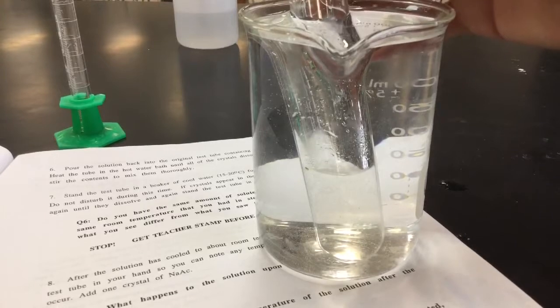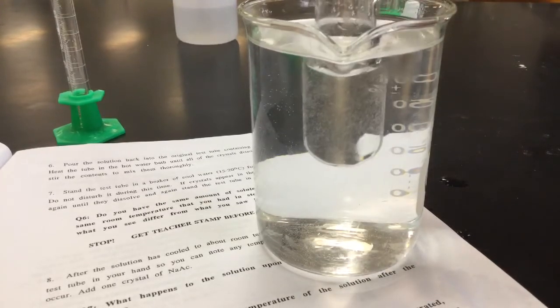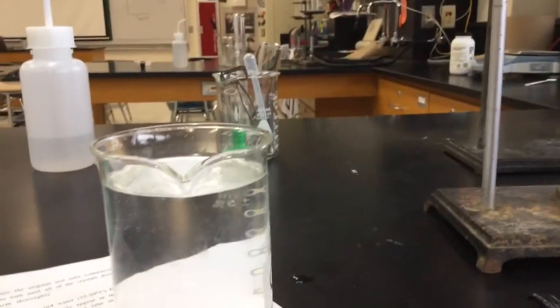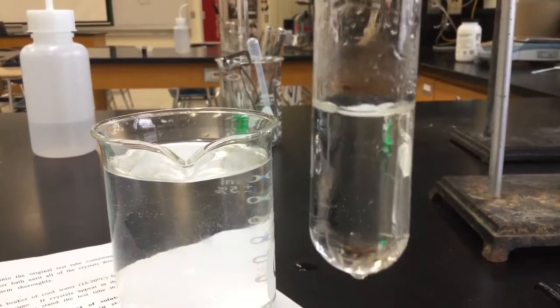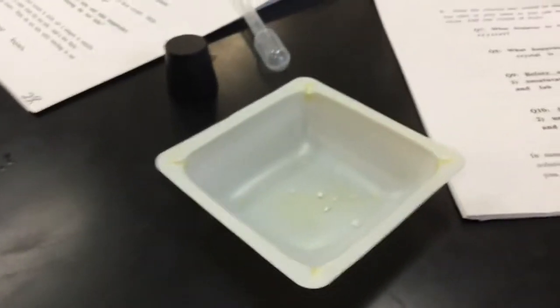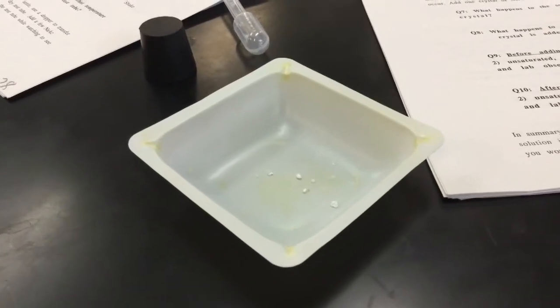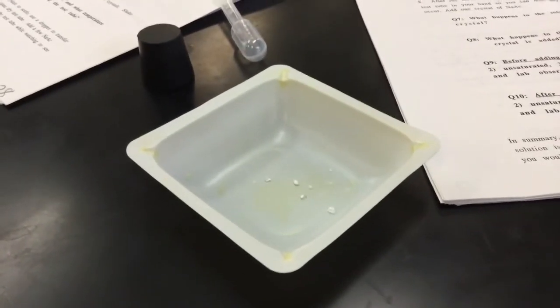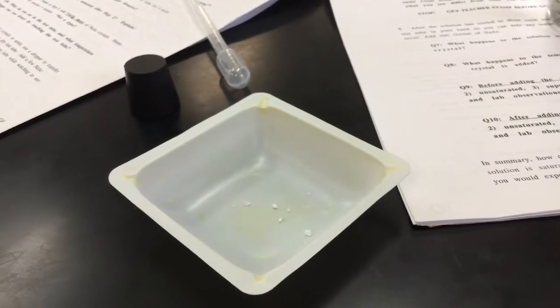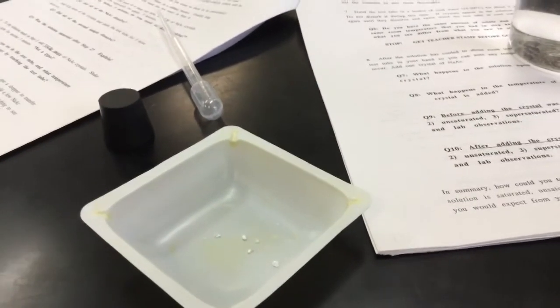I think I'm about ready. I'm going to remove the test tube — you can see it's perfectly clear, no crystals, nice and cold. I'm going to find a crystal — you can see there's one still in the weigh boat. I'll use that crystal and drop it into the supersaturated solution. That's going to cause it to remember that it shouldn't hold as much as it does. It's one of the reasons why I love science.